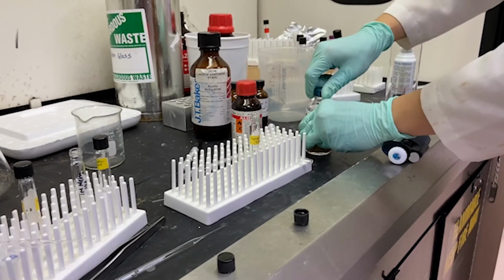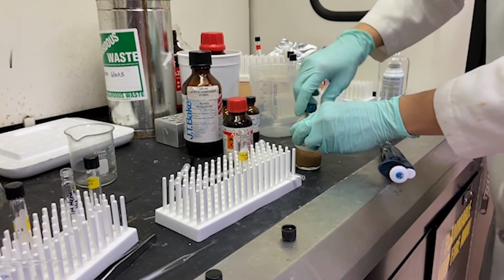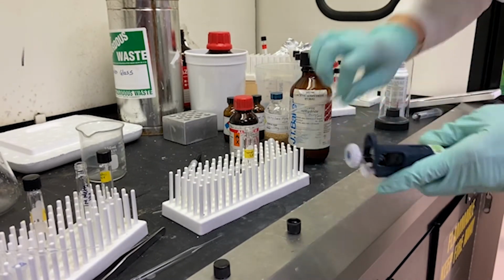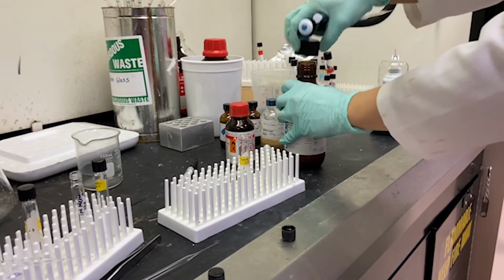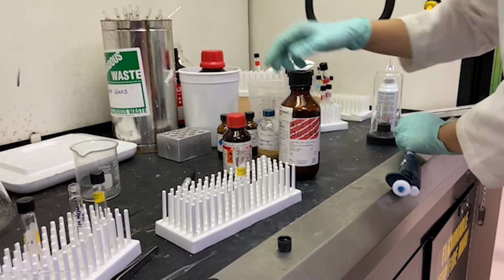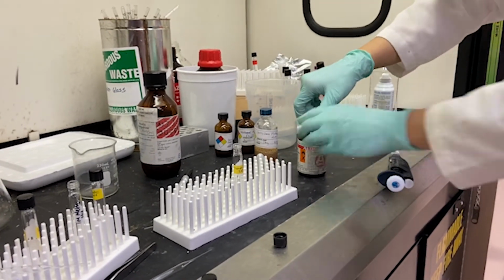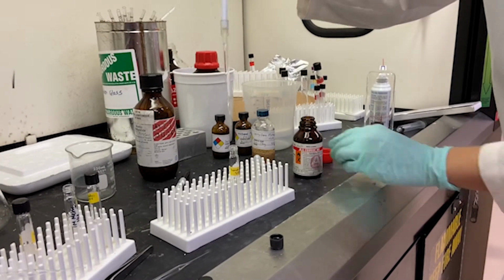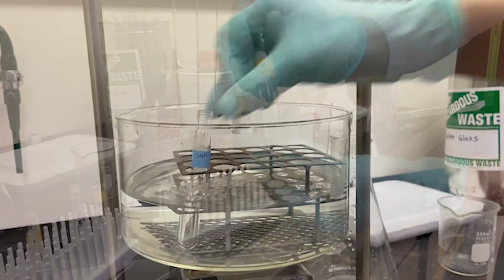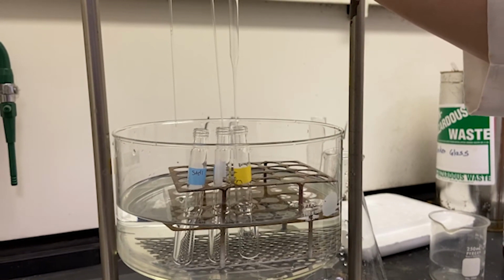Next, we move on to the re-N-acetylation. We add 200 microliters of methanol, 100 microliters of pyridine, and 100 microliters of acetic anhydride. The 2:1:1 ratio is important. We vortex the solution and allow this to sit at room temperature for 30 minutes. After sitting at room temperature for 30 minutes, the samples are then dried down completely under nitrogen. This takes about 30 minutes.